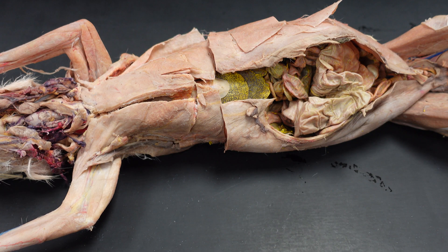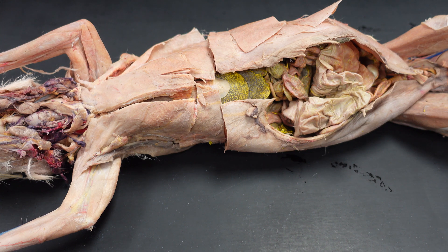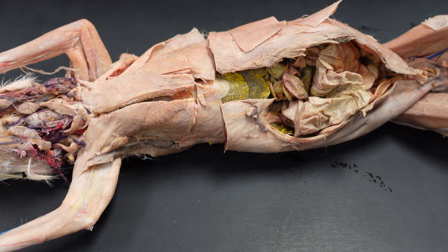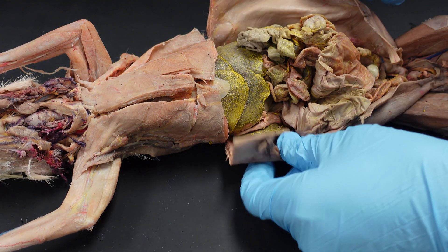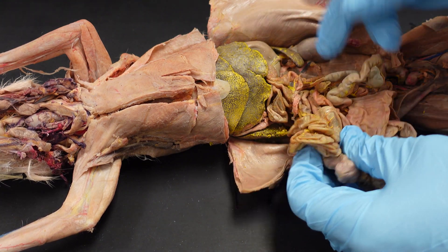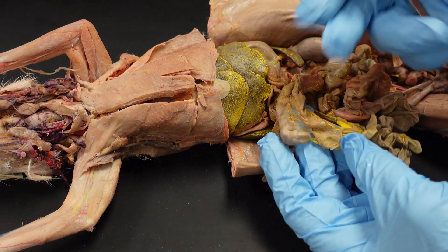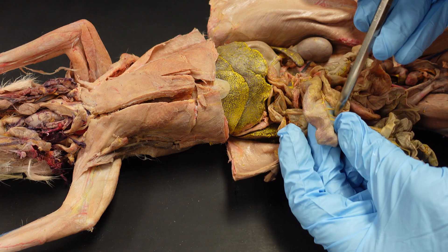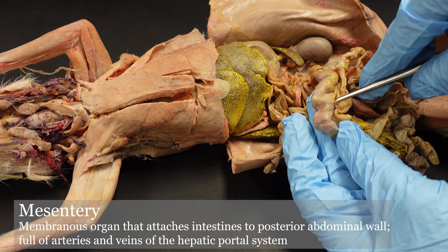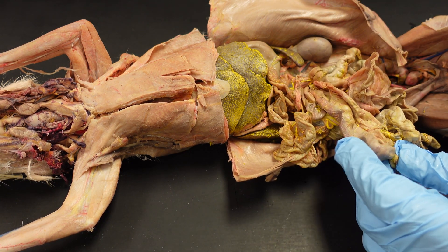Hi everyone. In this video we want to go over the rabbit digestive system, at least the parts that we want you to know for your exam. I have already opened up my rabbit and gone through and separated some of the digestive system, although I didn't completely separate all of the mesentery from the surrounding intestines. Bear with me as we go through this.